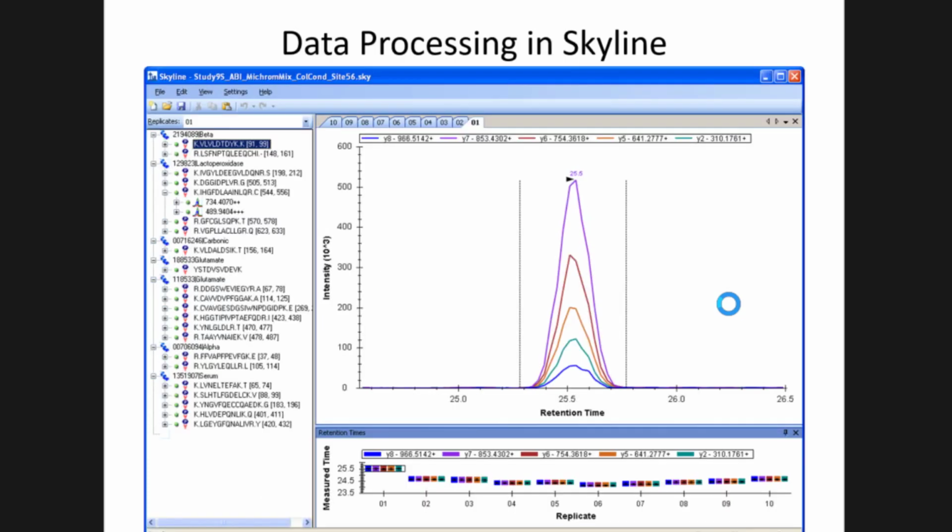Skyline has a lot of nice features that allow you to look at the data from a high level and say, oh, well, for this one run, we've got great peak shape, but I can look at the reproducibility of the retention times across 10 injections. I can see that injection 1 eluted a little later, and then they drifted earlier and stabilized, maybe going back a little later.